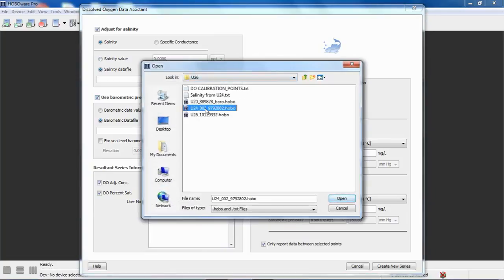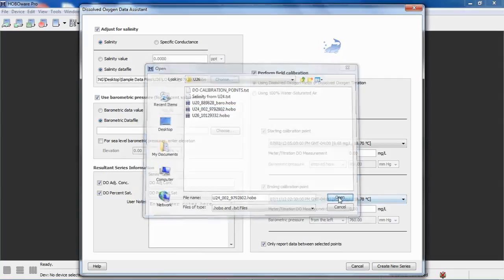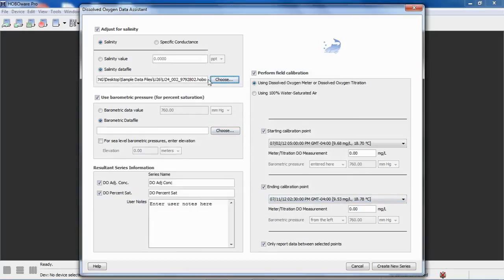So here I will select my U24, my raw data. You could also post-process your U24 data to get salinity using the conductivity assistant. Using the post-processed data from the U24 gives you the best accuracy because you have the ability to calibrate that data for drift over that deployment. With the raw data, you don't. But for this exercise, we'll just use the raw data. So we'll click on Open, and now you can see that it's associated with this adjustment for salinity selection.